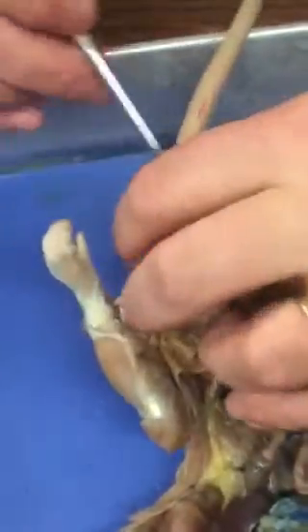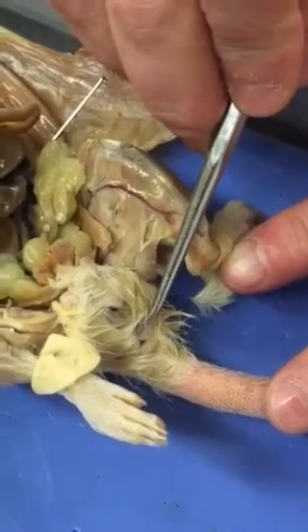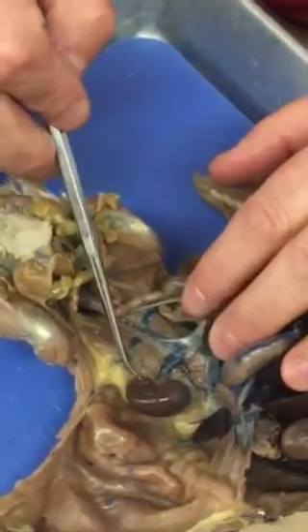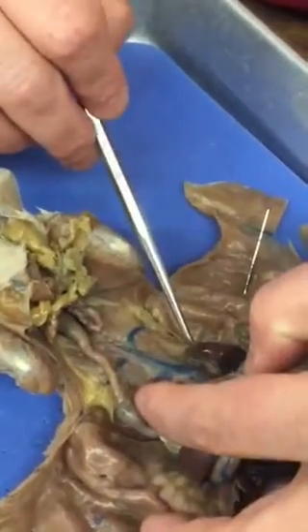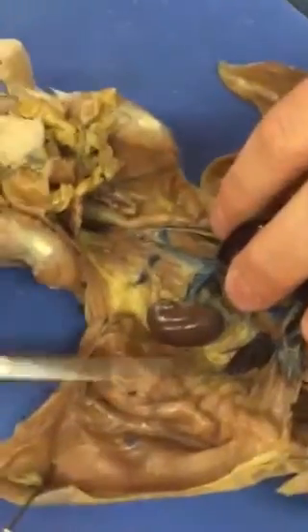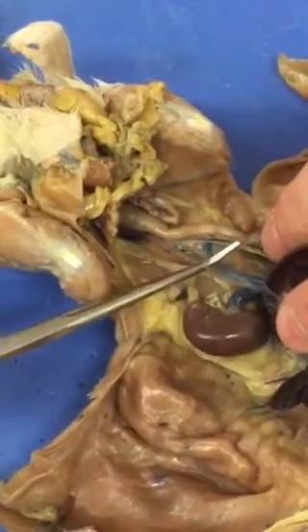And the anus is at the base of the tail, and so a little easier to see on this female, right there. That is the anus or anal opening. If we go back inside the rat, we can see the kidneys. They are paired, one on either side of the body. And there is a very delicate hair-like structure, a duct, that drains urine from the kidney to the bladder.